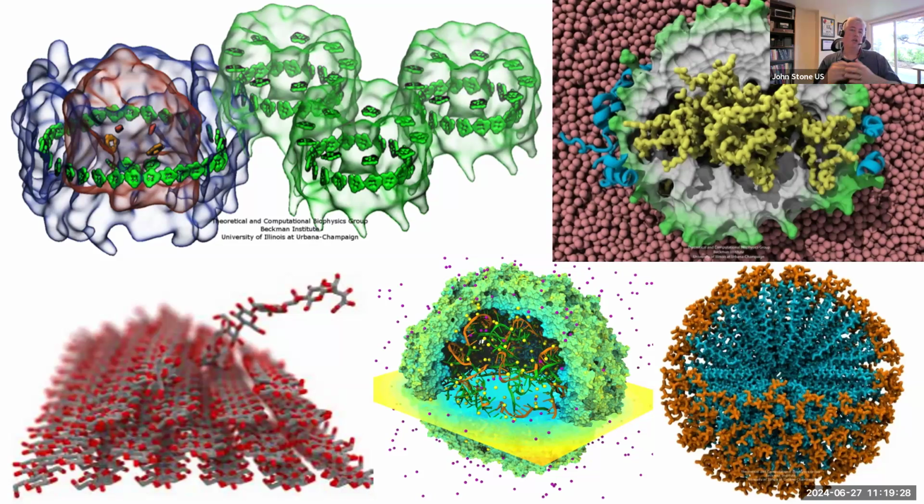You're going to want to show a key site where something that is biophysically interesting is taking place, but you want the context of that whole system shown in some way. So VMD has a bunch of sophisticated ways of drawing transparent surfaces. The one that is shown here is somewhat basic, but the advanced rendering methods make those work very well.